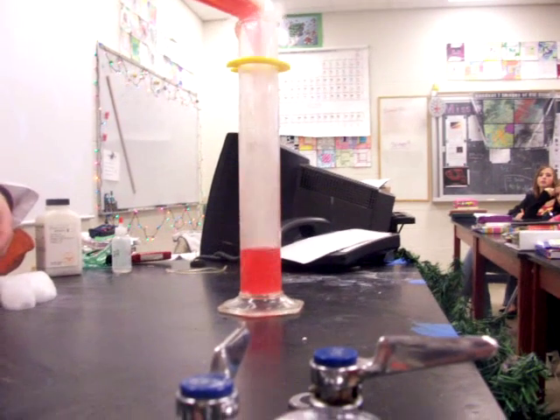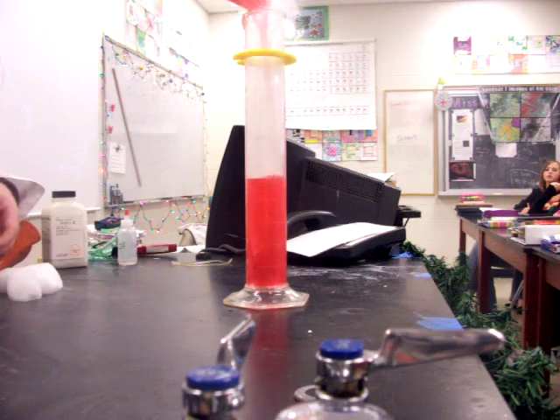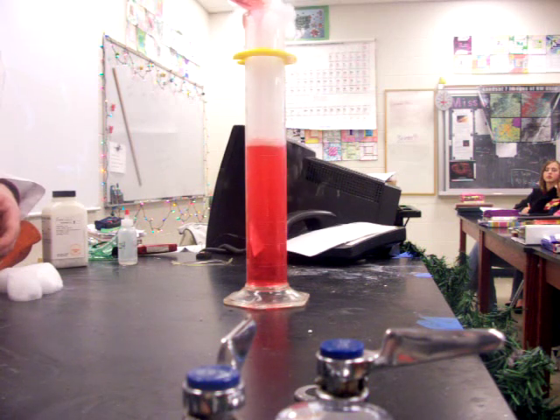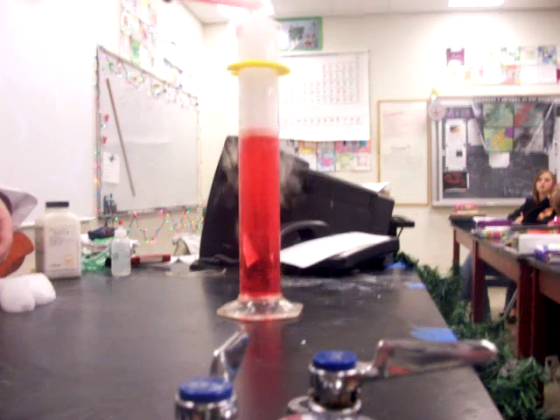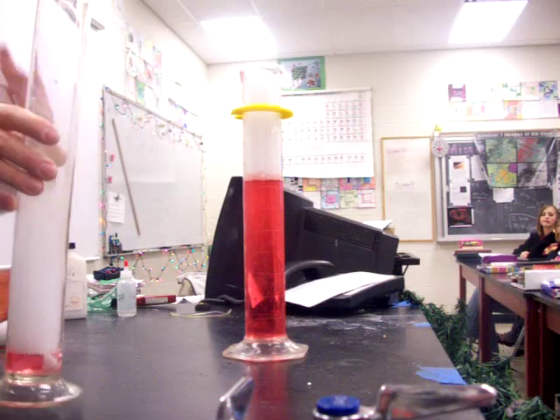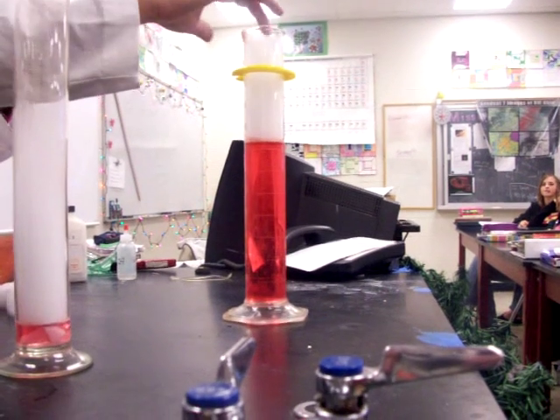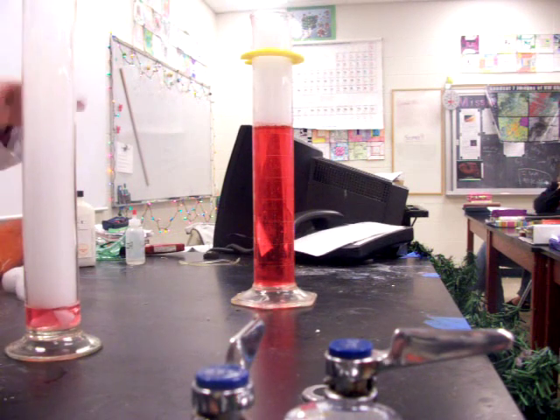I'm pouring off the liquid here. Of course, the carbon dioxide is being poured off as well. It's heavier than air, so you can see it sinking. You're seeing the water vapor condensing on the carbon dioxide there, not actually the carbon dioxide.